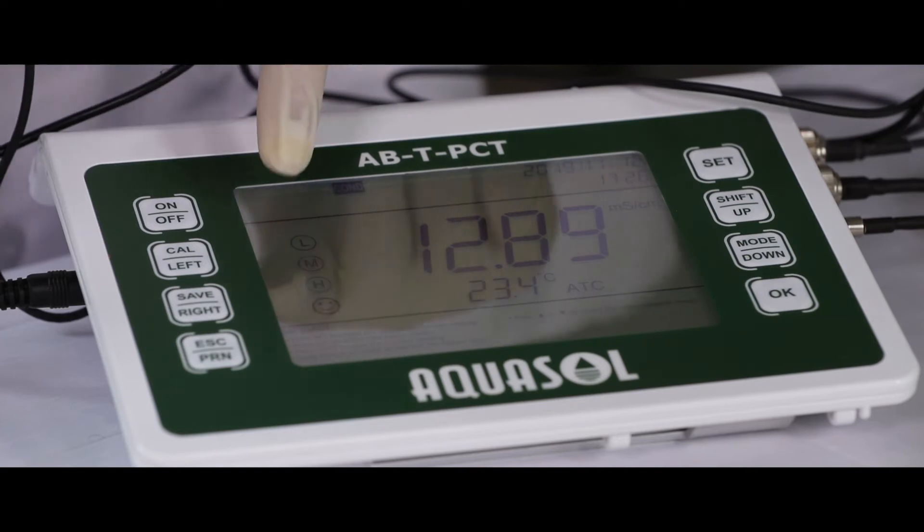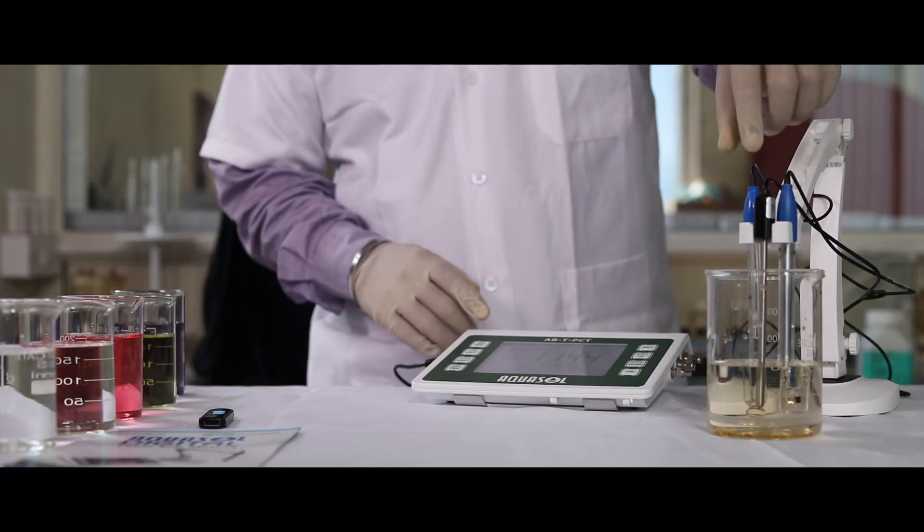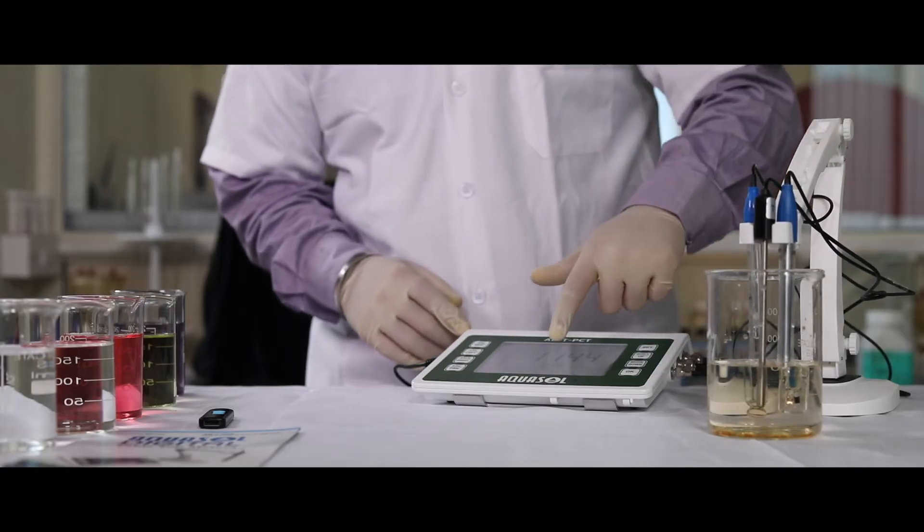L, M, H will appear on the display. Now we are ready to test the sample. Dip the electrodes in the sample solution for reading.